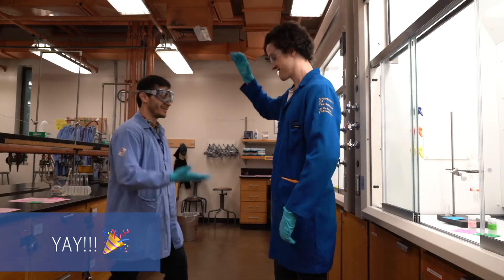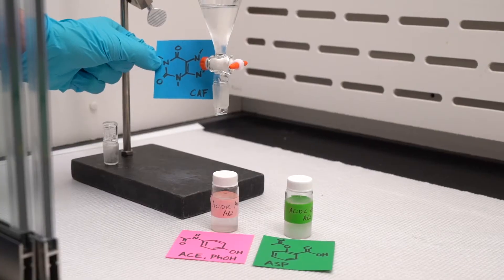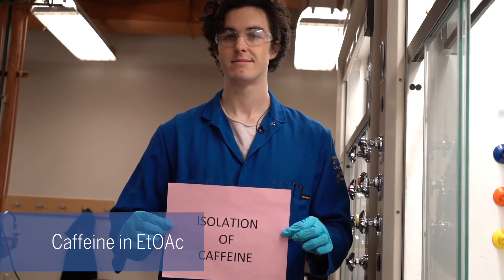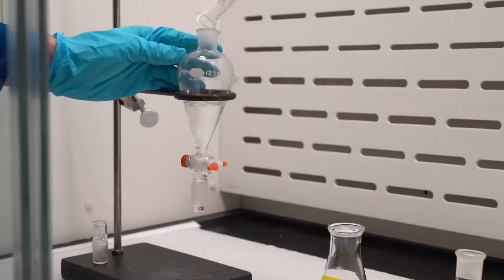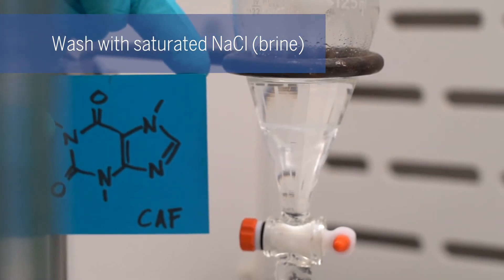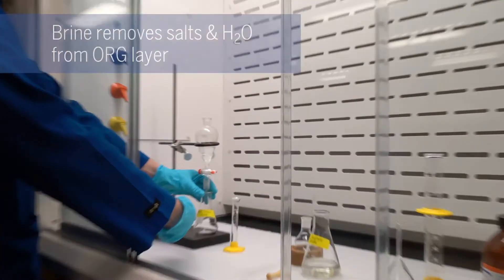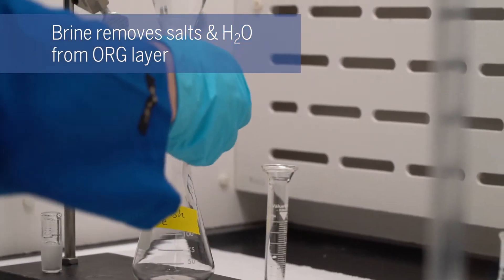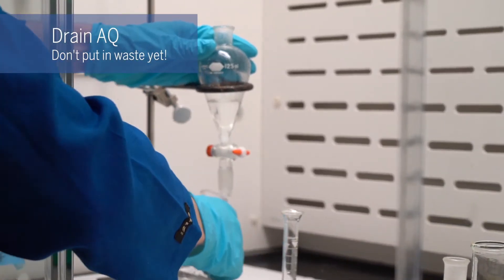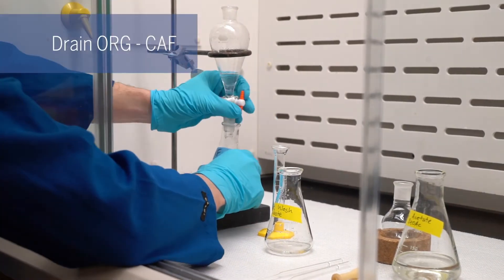Aspirin and acetaminophen are in their own scintillation vials waiting to be isolated, and caffeine is the last remaining component in the separatory funnel. We're going to start with the isolation of caffeine — it is currently dissolved in ethyl acetate. So we're going to start by adding 10 mils of brine. The brine shouldn't have any caffeine in it but we'll still save it, which is typical when doing extractions. We're going to drain the brine into a clearly labeled Erlenmeyer and save it for later, then drain the ethyl acetate into a clearly marked Erlenmeyer to capture the organic layer.